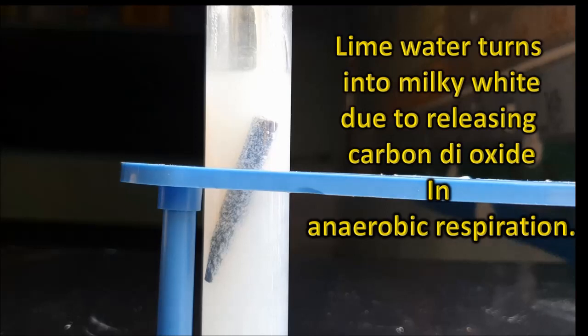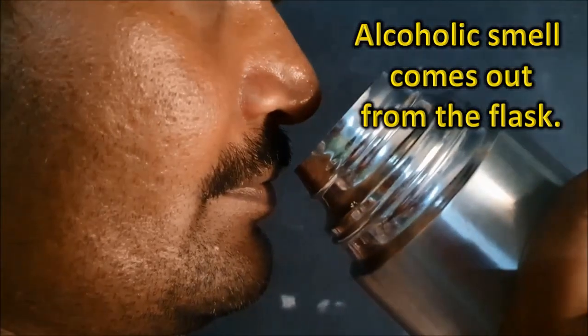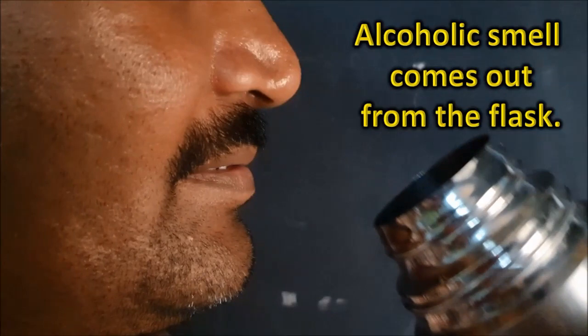Lime water turns milky white due to the release of carbon dioxide in anaerobic respiration. The alcoholic smell comes out from the flask. So from this we can say that the end products of anaerobic respiration are ethanol, carbon dioxide, and energy is released in the form of heat.